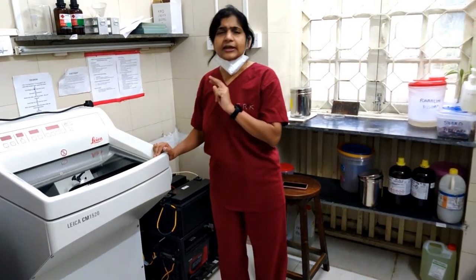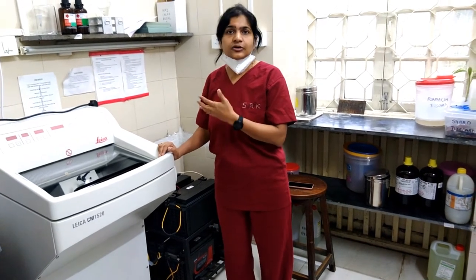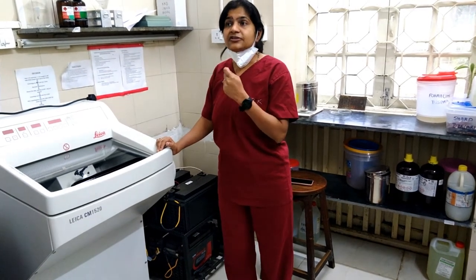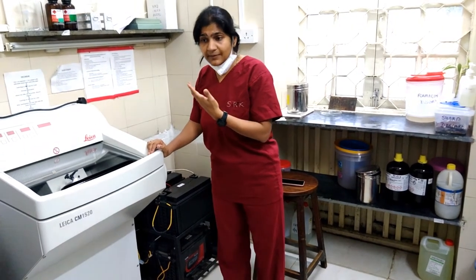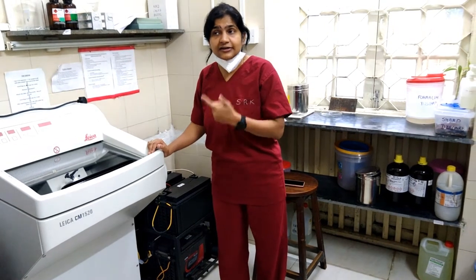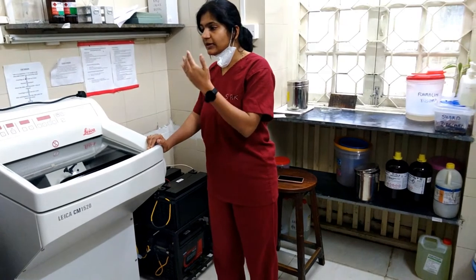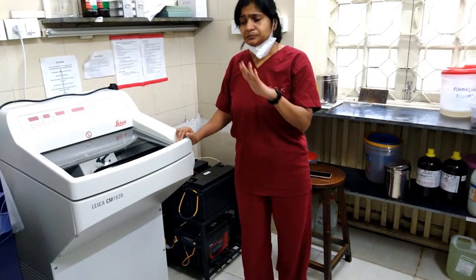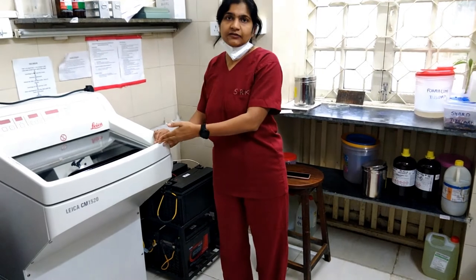The second important capability we have already started is frozen section diagnosis. Whenever there is a tumour and the surgeon is removing it in the OT, they need to know immediately what the pathology of the tumour is — whether it is benign or malignant. That diagnosis is required immediately on the table, and for on-table diagnosis we need to see the pathology on the frozen section. Without this device, we could not do frozen section pathology.